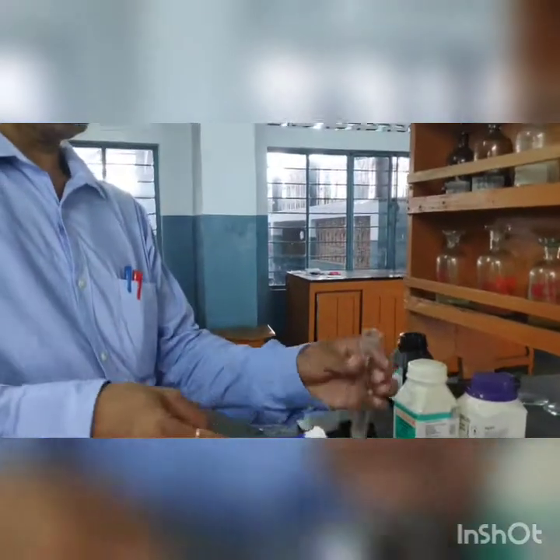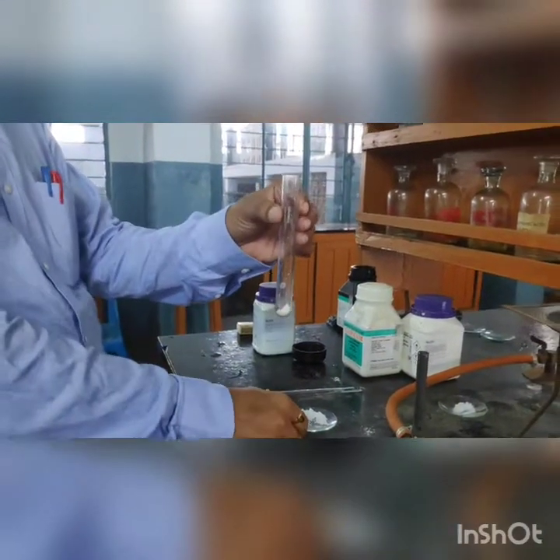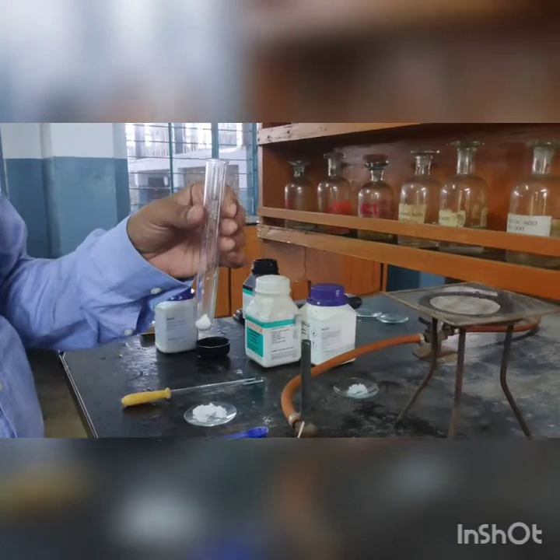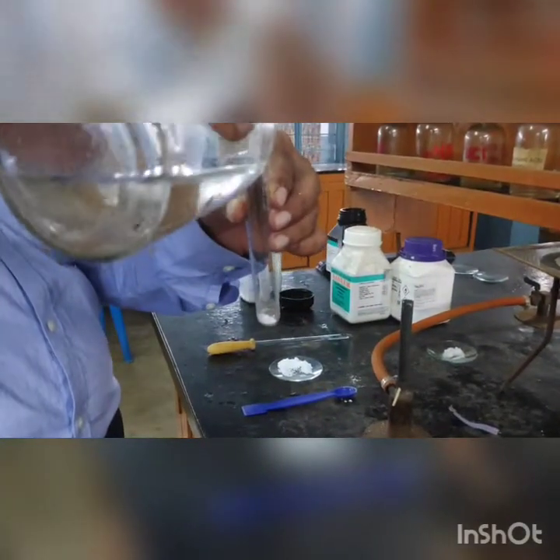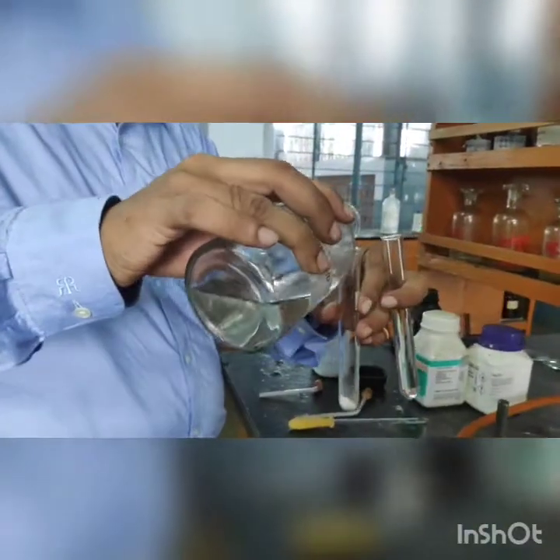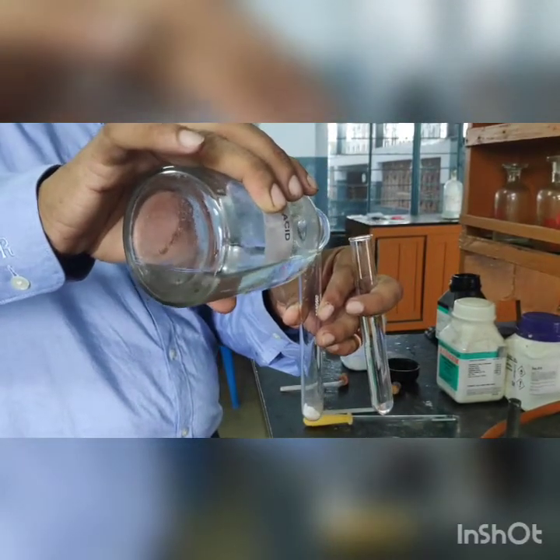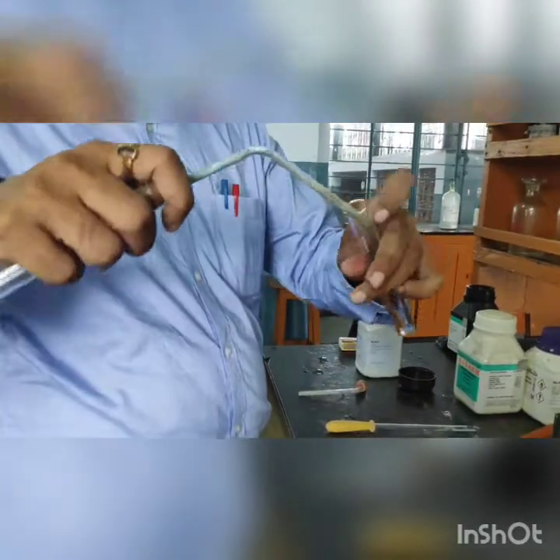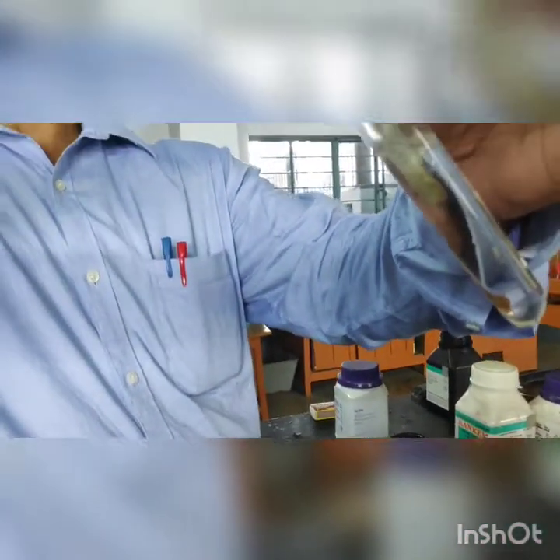Now we will test another anion — the carbonate radical. We have taken a salt containing the carbonate radical. The test for the carbonate radical does not use the filtrate, because in the sodium carbonate filtrate we have added carbonate ourselves. So dry salt is taken in a dry test tube and HCl is added, whereupon there is immediate effervescence and the gas evolved is passed into lime water.